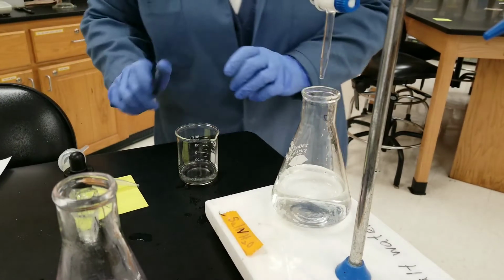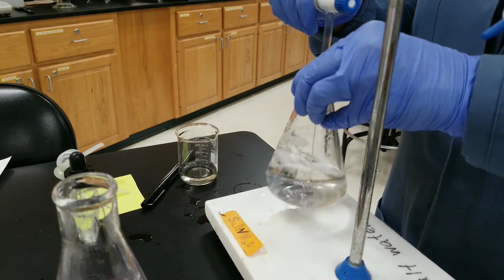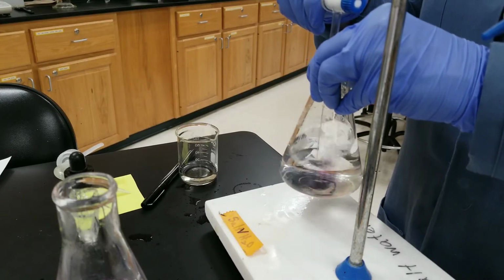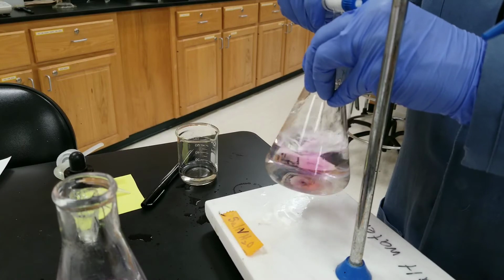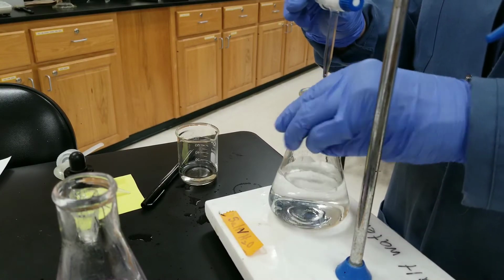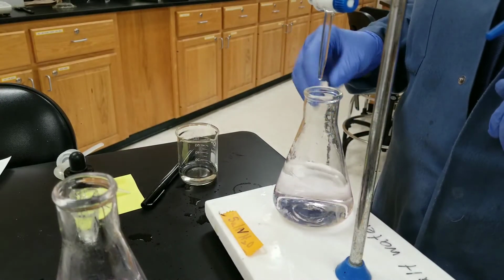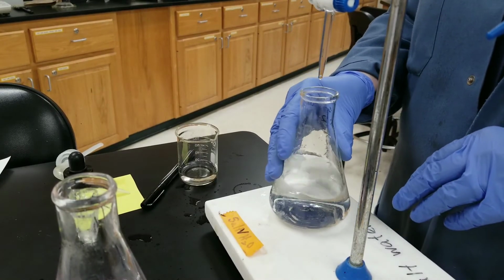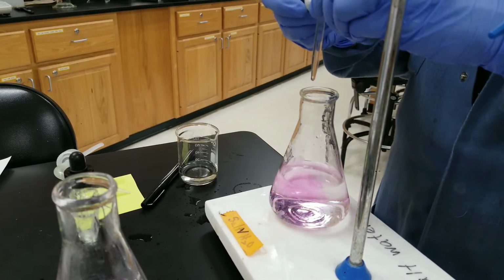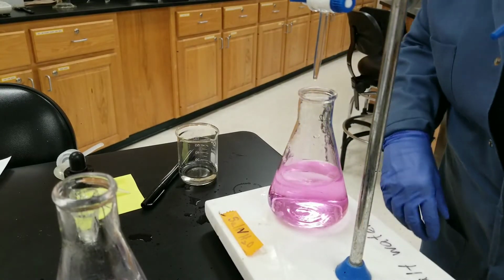And we'll go ahead and close. And it's very, oop, didn't quite stay long enough, but I'm probably within a drop of it. Ooh, that got stuck. So it's a little bit darker pink than I'd like, but we will take it as a reading.